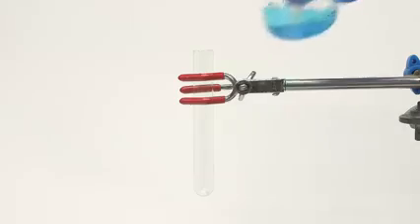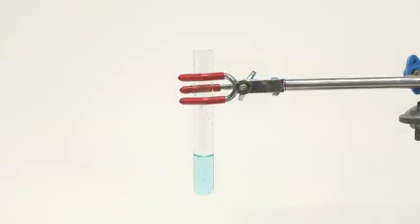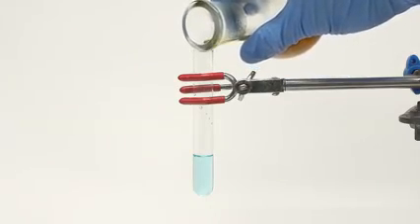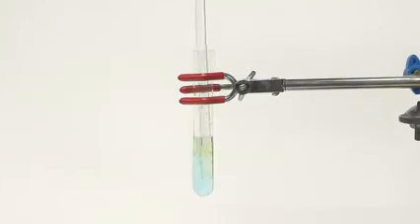A simple way to test it is to use copper salts, usually copper acetate, but I only had copper sulfate on me. I made a concentrated solution of copper sulfate, and then I added a little bit of my oil. I quickly mix things around a little bit, and I wait to see if a color change occurs. Unfortunately, the oil very clearly takes on this green color, which indicates the presence of fatty acids. It doesn't say whether triglycerides are present or not, but so far it doesn't look promising.